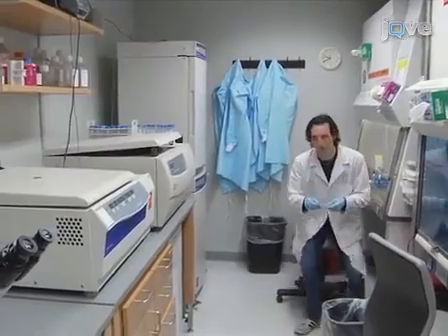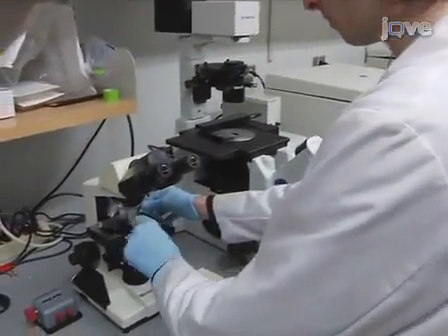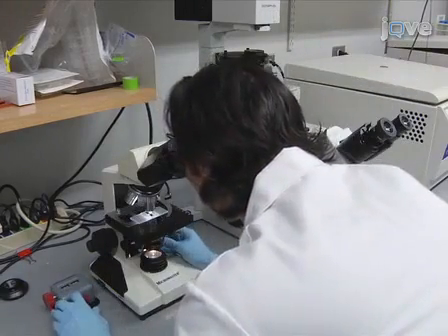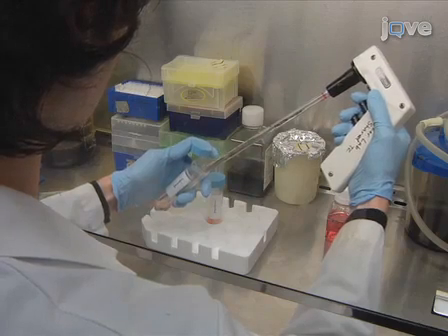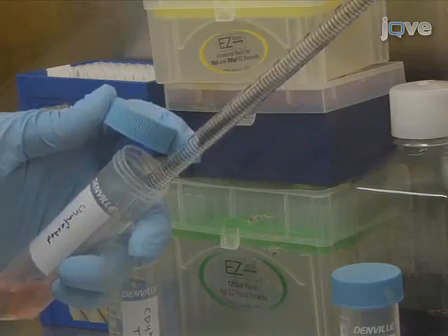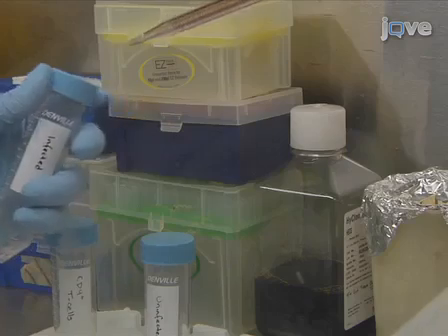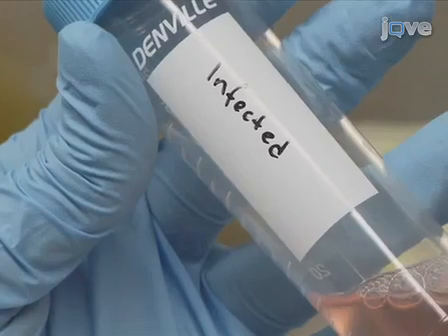After CD4 positive T cells have been isolated from human peripheral blood and stimulated with anti-CD3, anti-CD28 coupled beads for 72 hours, count the resulting T cell population by hemocytometer and then split the culture into two groups. Add approximately 2 × 10⁶ T cells to a 15 ml conical tube for use as the uninfected control group and place the remainder of the CD4 positive T cell suspension into a 50 ml conical tube for the infection group.